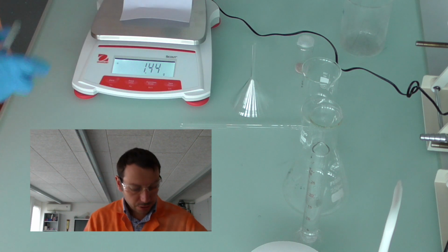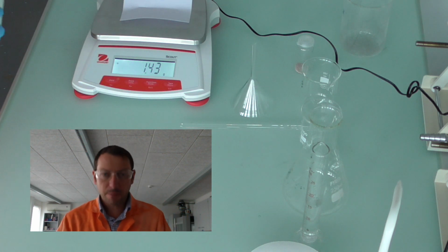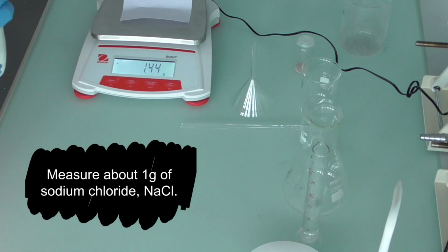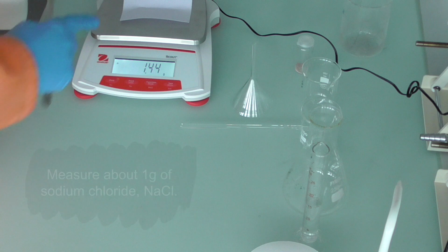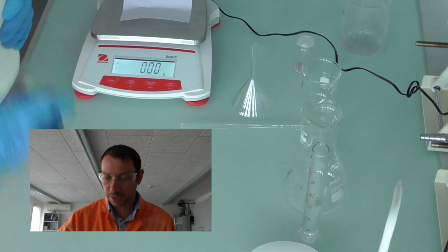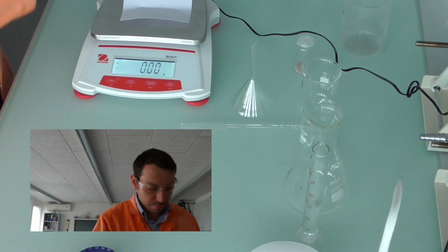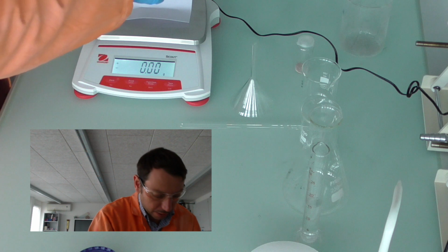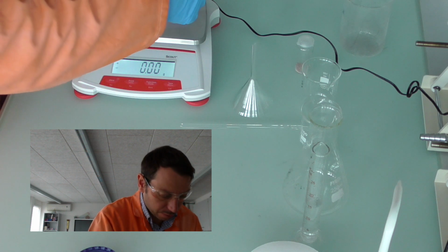So the first thing we need is about 1 gram of sodium chloride. I'm going to use either a weighing boat or a scrap piece of paper, put it on the balance and re-zero it. You can see it's about 0 now. We say about 1 gram because we're going to do the calculations at the end to work out which one is in excess and which one is the limiting reagent.